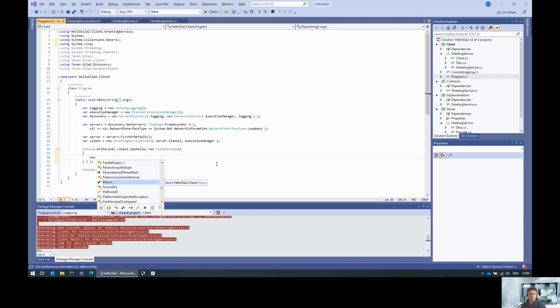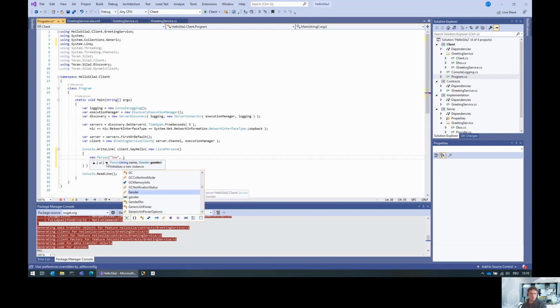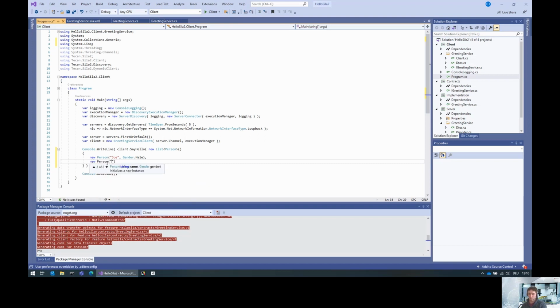Okay, so let's do the person with name Joe, and the gender, let's put that to male. Sorry, to the constructor. So Joe, which is male. And then we have Jane, which is female.